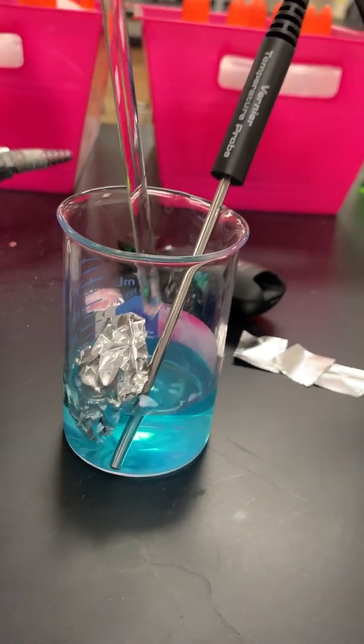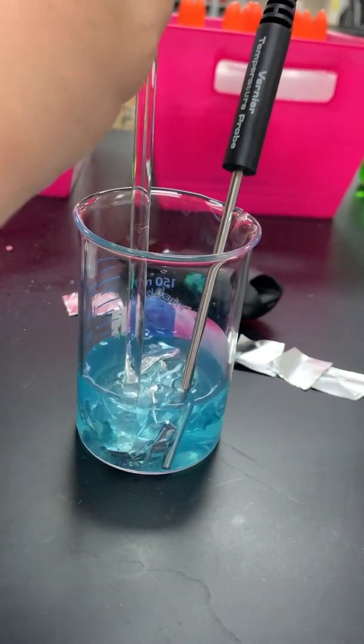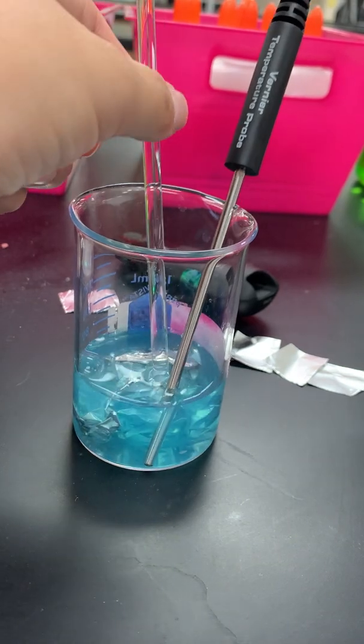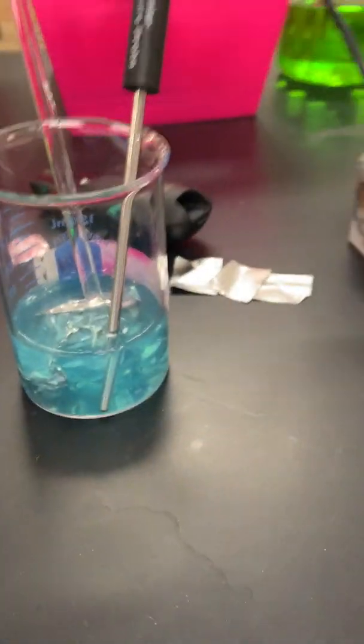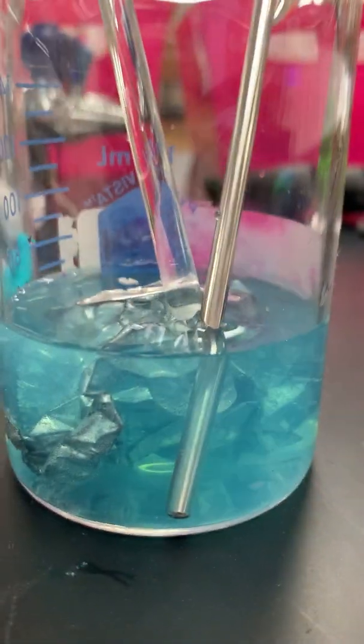So I've put my aluminum foil in the mixture and I'm going to use my stirring rod to kind of poke it in there. Make sure it gets really good and in there. So you're going to want to watch as this sits in here and see what happens. So don't pause this time. Just keep observing. I'm going to scooch this nice and close so you can really see what's going on.